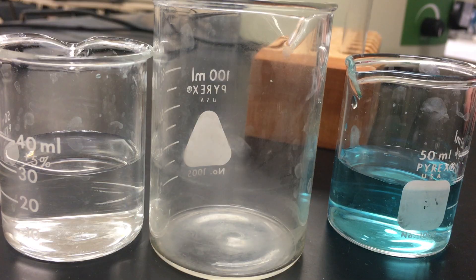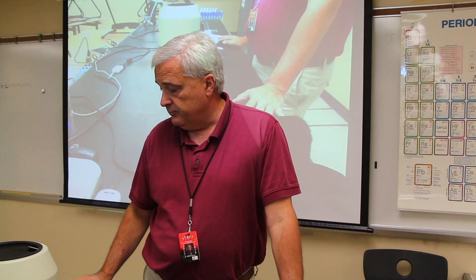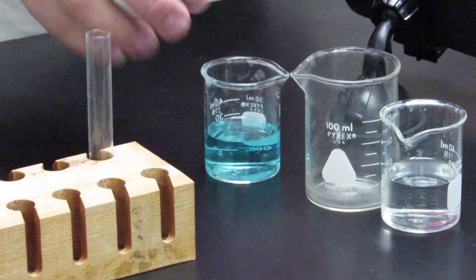One of the evidences of a chemical reaction is the formation of a precipitate in a solution, and so I'm going to quickly demonstrate that with sodium hydroxide and copper sulfate. We have a solution of copper sulfate, which is the blue, and we have a solution of sodium hydroxide.